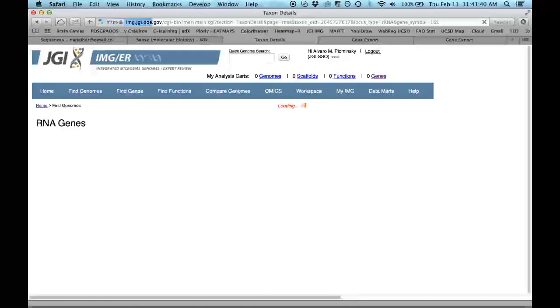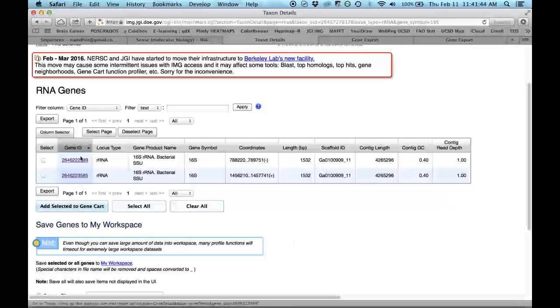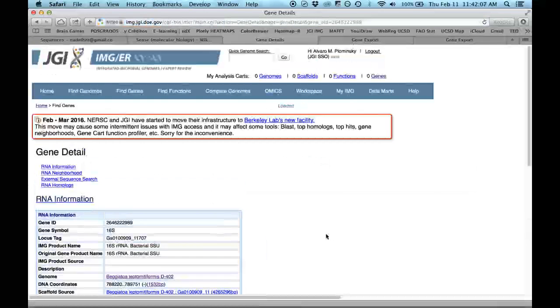So for that genome, for that strain, you have two sequences. I pick just one. It has to be the same sequence actually. However, you have the coordinates from the location, from the sequencing, the negative one and a positive one. So that is where I messed it up. I will pick the same that I have already there.